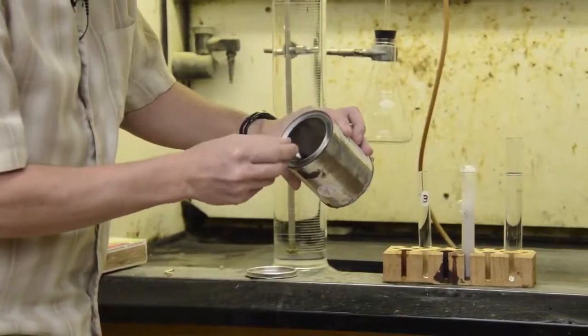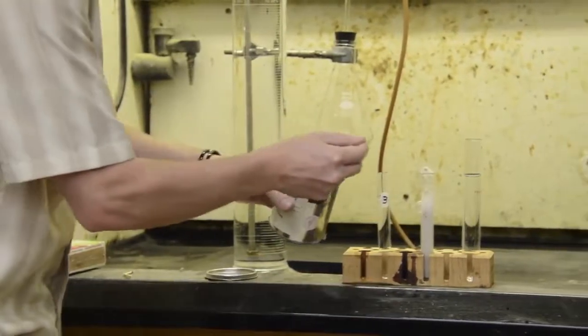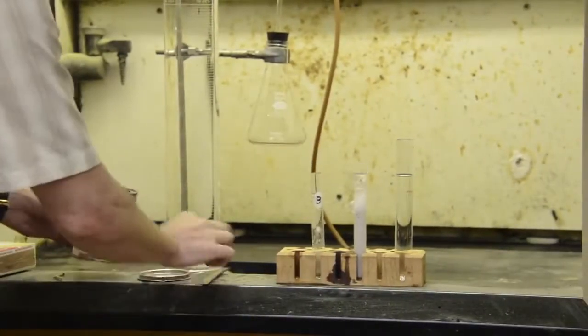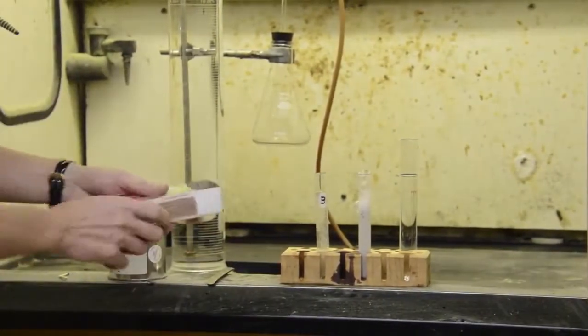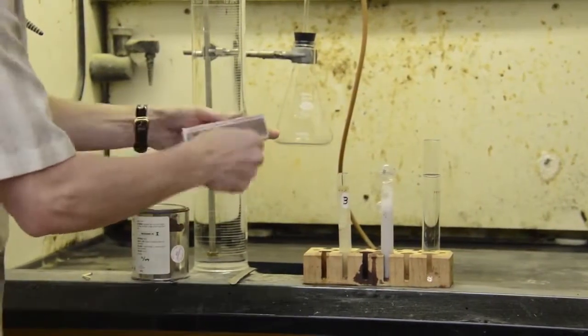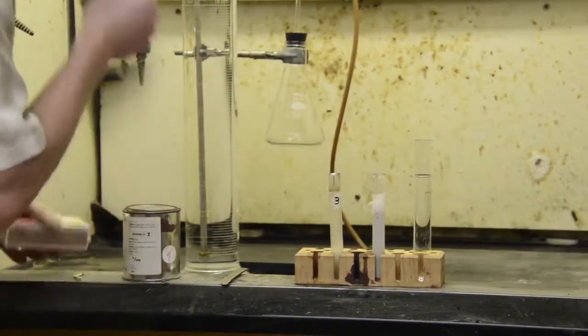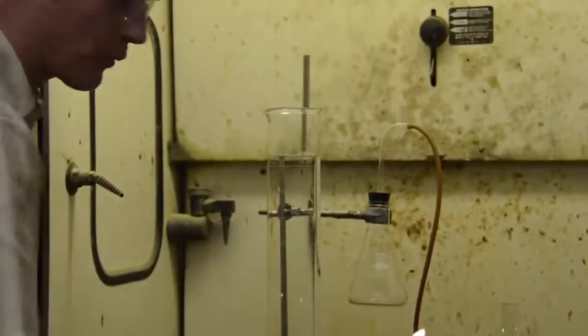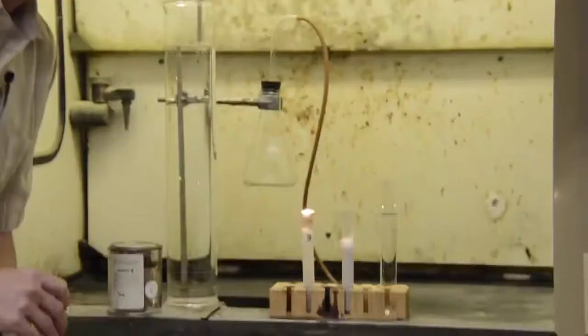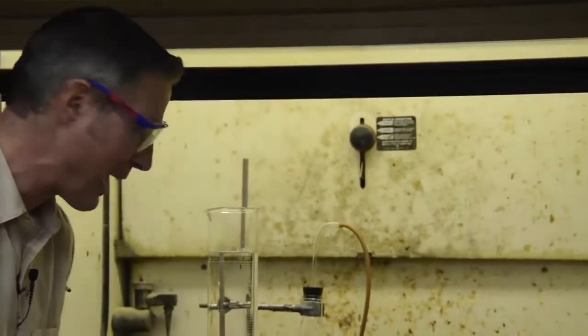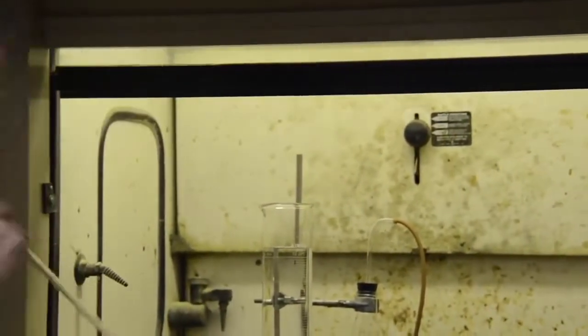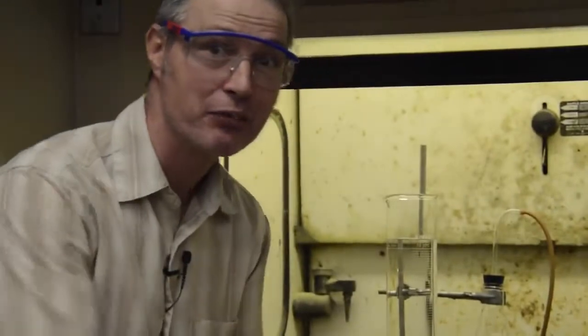I'm going to use one little teeny piece of calcium carbide right there. We're going to light it just like a cave explorer does. You can see this soot coming off. There, there you see it. Dirty, dirty, dirty. Bad flame. Clean, clean flame.